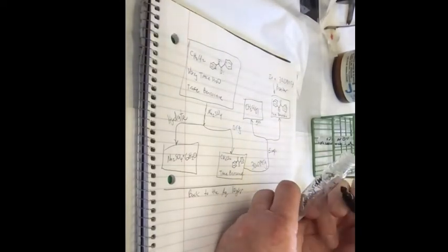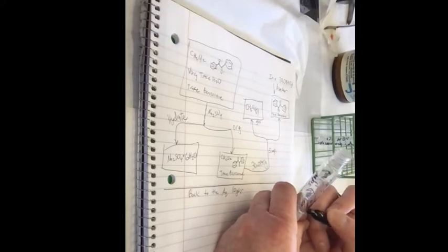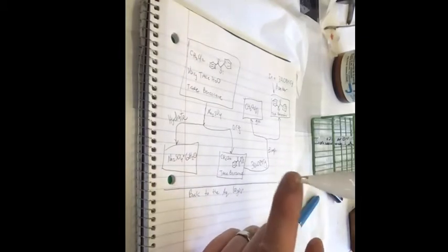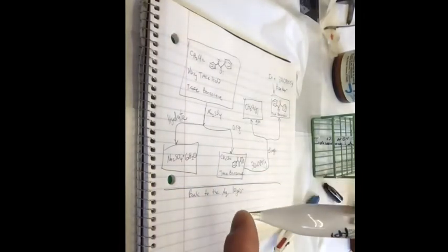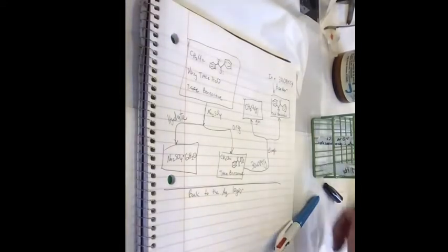This was methylene chloride, but now it's the second precipitate, and you can see it's kind of cloudy, and there's a little bit of organic methylene chloride in the bottom there, and that's probably dissolving some of the precipitate into it, so that's why it doesn't look like a lot.